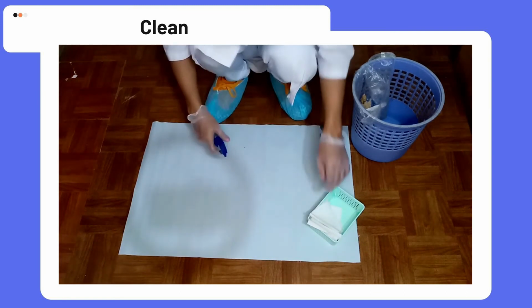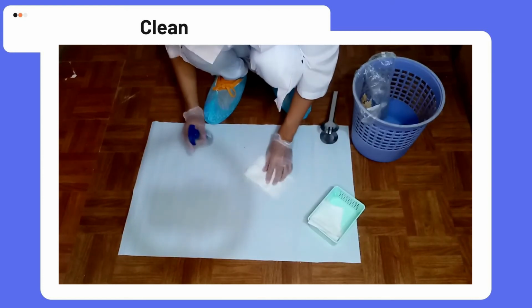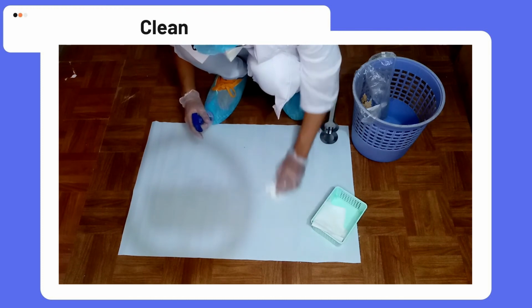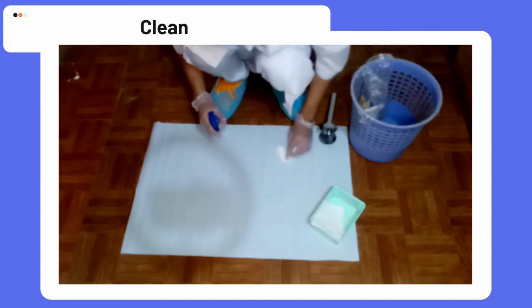Using a detergent solution, decontaminate the surface and use another absorbent pad in order to clean up the surface. Carefully clean up this surface and after cleaning, dispose of the used absorbent pads directly to the hazardous waste bag.